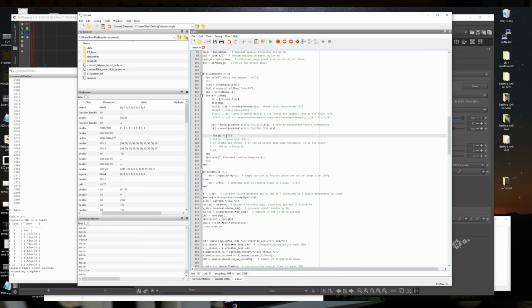The bright field images, the ones that come from the center where the illumination is directly below, are obviously quite a bit brighter than the ones off to the side. So the question is, can you change the exposure? Does the algorithm allow you to have different exposure levels? I actually never quite figured this out. I think the short answer is no.